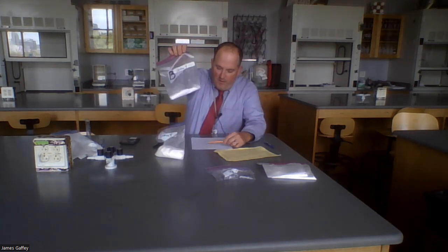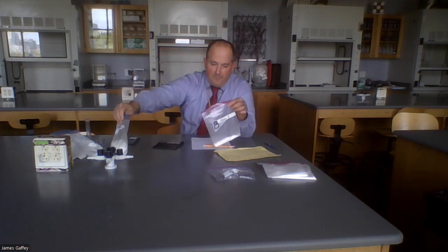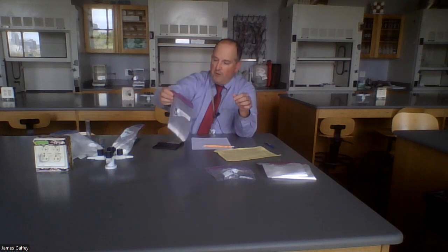And it's definitely much, much larger than sample B, whose mass was measured to be 57.6 grams. That one, sample B, is much, much closer to sodium chloride's calculated molar mass of 58.5. Thus, we conclude that sample A is sucrose and sample B is sodium chloride.